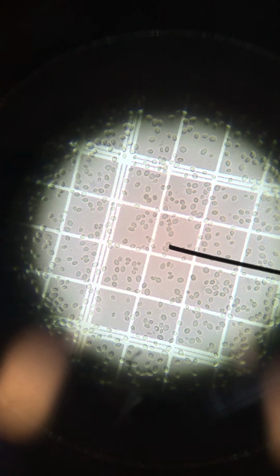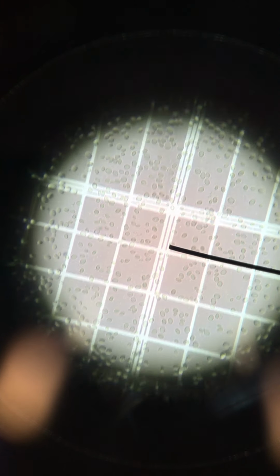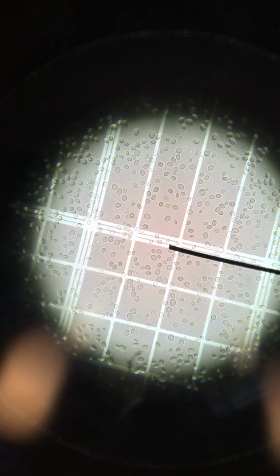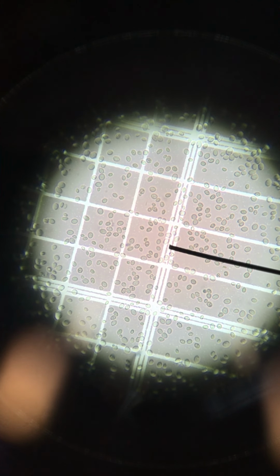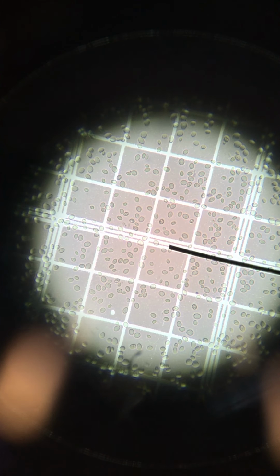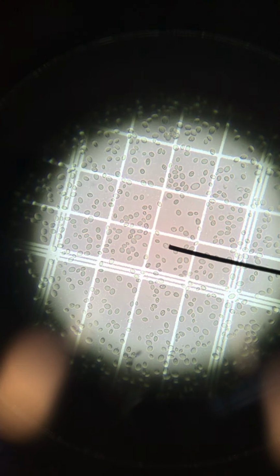Well, the convention with hemocytometers is that when counting any particular square, any cells that are located on the left or the top border of a square, if they're touching those border lines, are counted in, but any cells that are touching the right or bottom boundaries are not counted, because then if you were to count an adjacent square, those cells could be counted by the other square. So that's pretty much all you have to do.